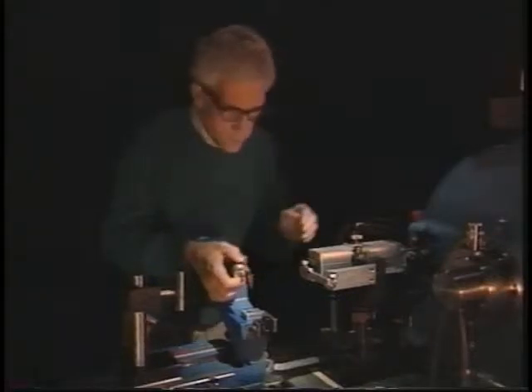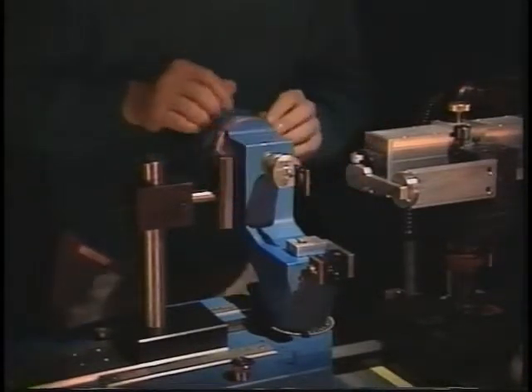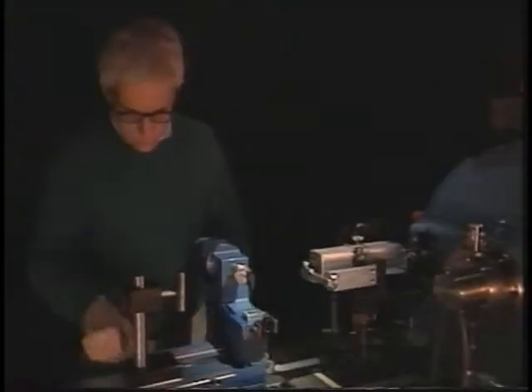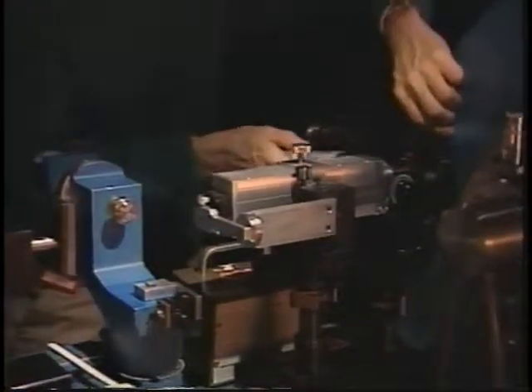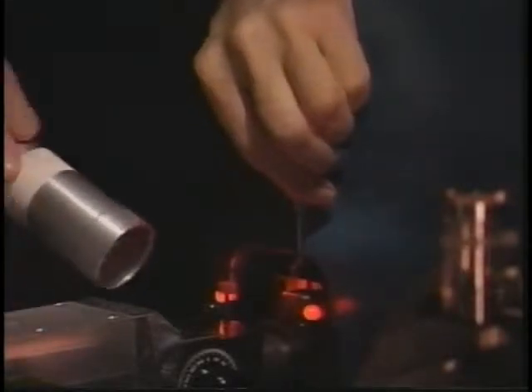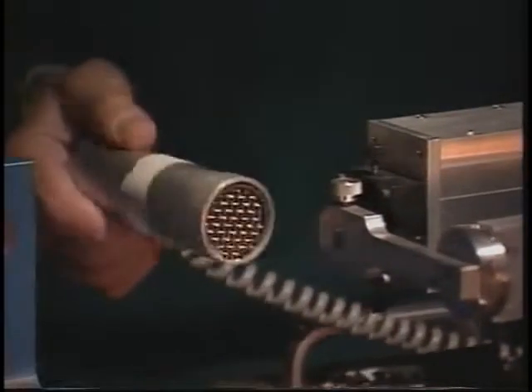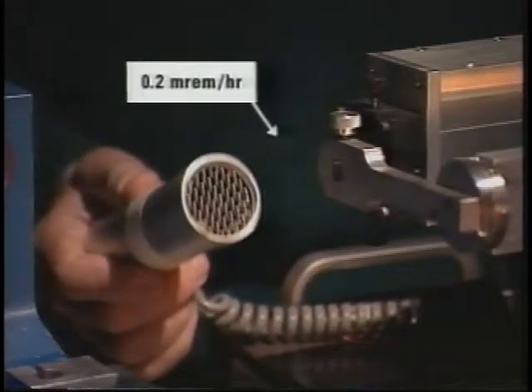Steve Harrison is a veteran in the now burgeoning field of structural biology, whose diffraction machine is an old unit requiring manual alignment of the beam. The beam energy is low. Its principal component is the characteristic radiation from copper at 8 keV. A radiation survey with the Geiger counter detects scatter, which results from the beam striking any obstruction, including air. In this case, the scatter from Steve's machine is relatively low because the finely focused beam has a diameter of less than 2 millimeters. The highest measured radiation at this point is 0.2 millirems per hour, which is not much greater than background.